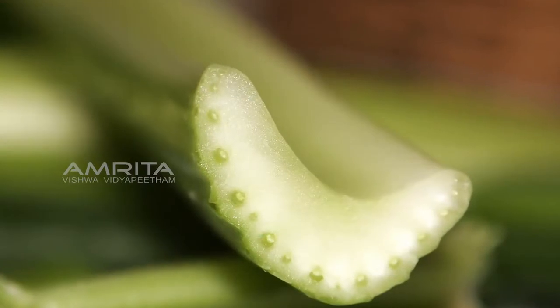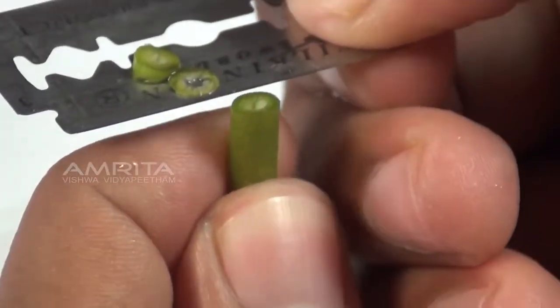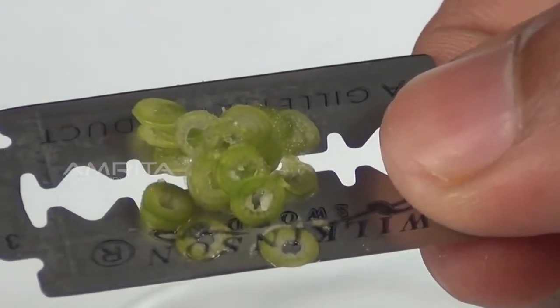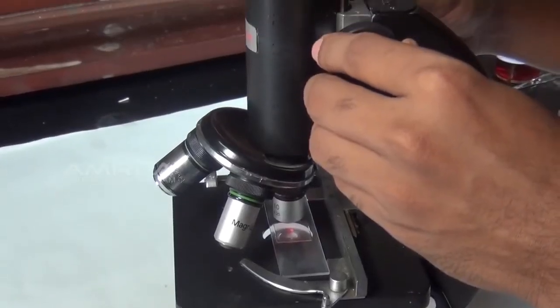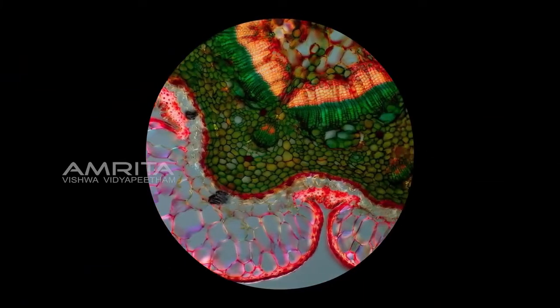To study the structural details of the stem or root of a monocot or dicot plant, it is essential to get familiarized with the sectioning and staining techniques used with plant materials. It is also necessary to take the sections with uniform thickness so that the light passes through them equally and the different tissues found in the material are clearly visible under the microscope.